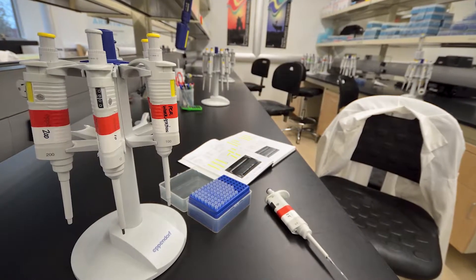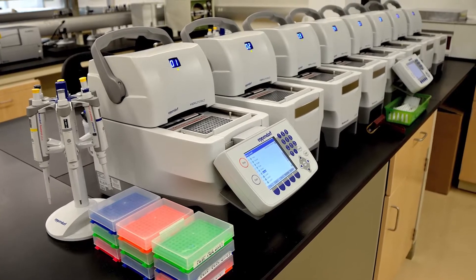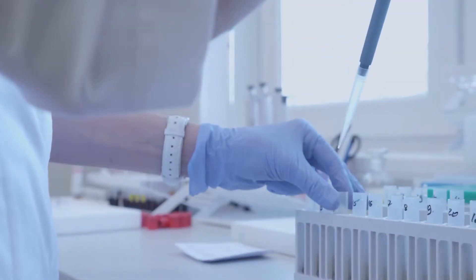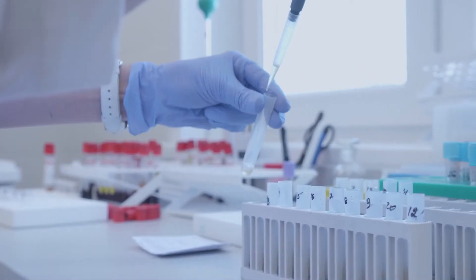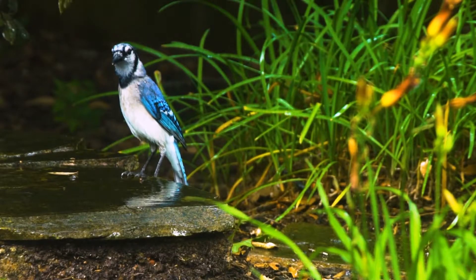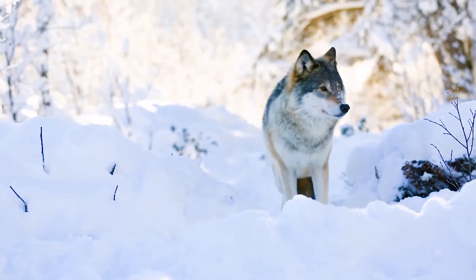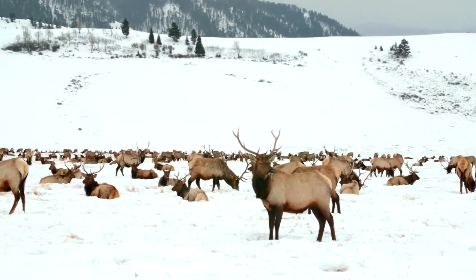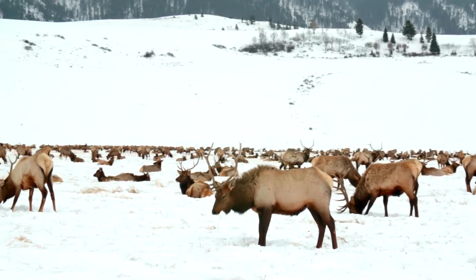Here at the Museum of Nature, we have a lab where we use the tools and techniques of biotechnology to unlock this information. This information is really important for biodiversity science — it lets us answer all kinds of questions like, what is a species? How are species related to one another? It can also tell us about the health of populations to help us make good decisions about conservation practices.